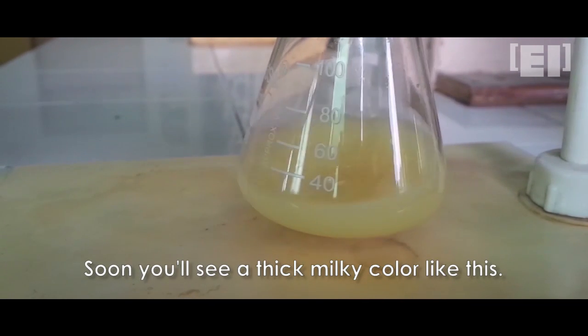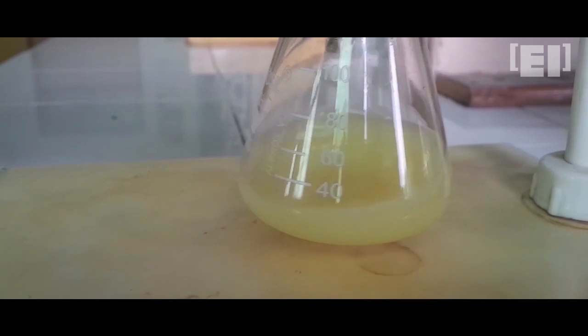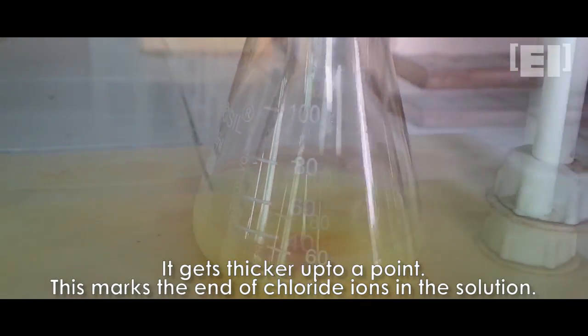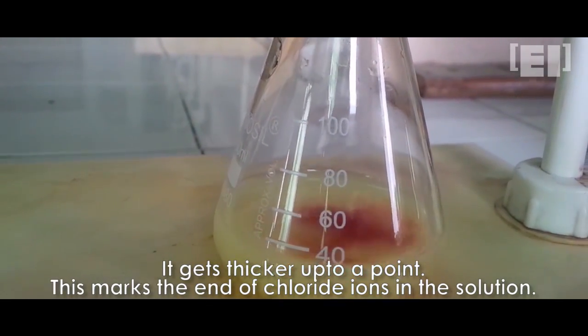This insoluble milky substance is AgCl. This marks that there are no more chloride ions left in the solution.